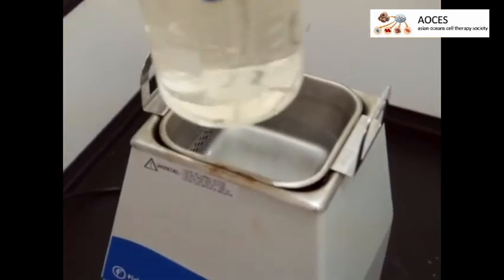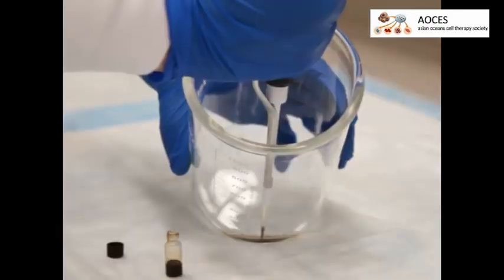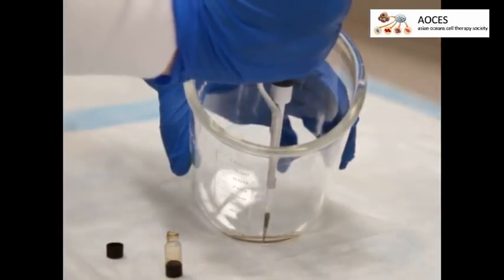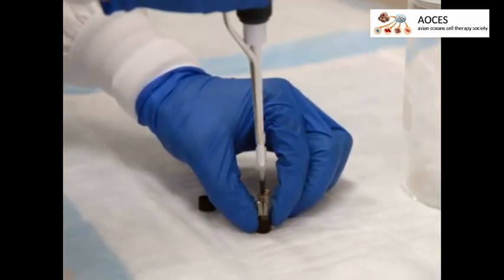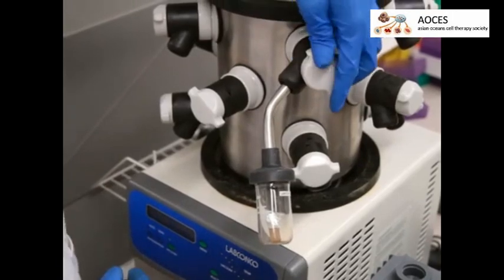Wash the spions 3 times with water, sonicating each time. After all 6 aliquots have been coated and washed, collect the spions into a single glass vial. Freeze dry the spion solution overnight in a lyophilizer.